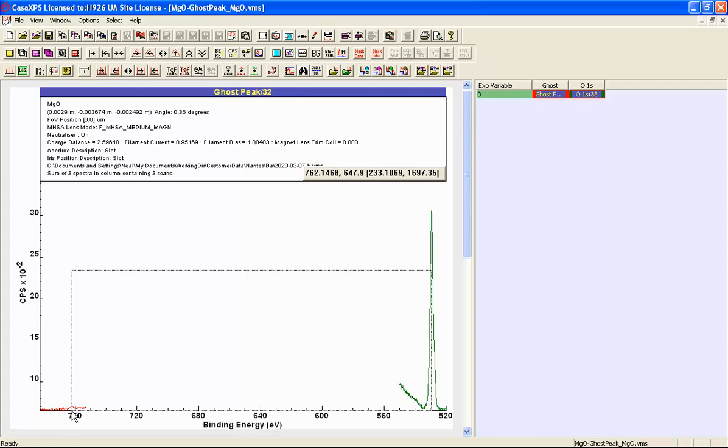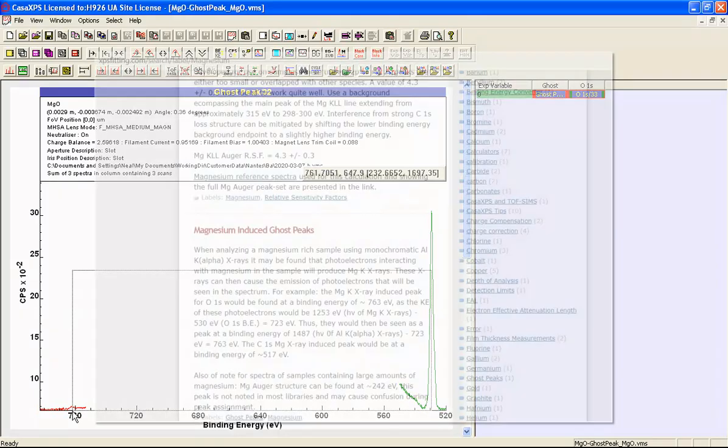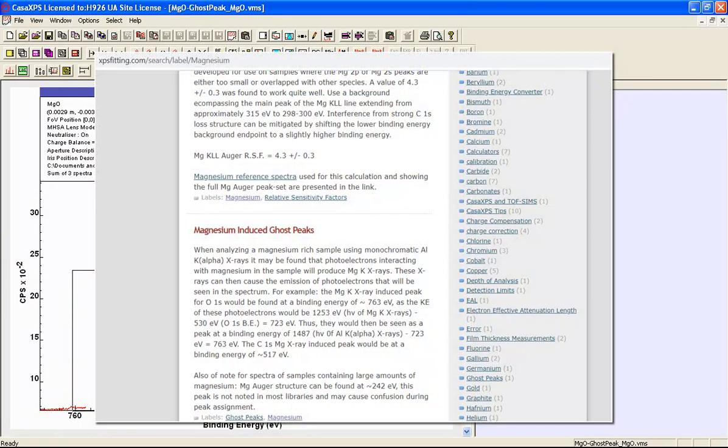And this is the difference between an X-ray energy from an aluminium anode and an X-ray energy from a magnesium anode. However, we have a monochromatic X-ray source, so we know there can't be X-rays that are generated from the anode. So the explanation that is given for this ghost peak is that this ghost peak is a result of X-rays that are being generated within the sample itself.